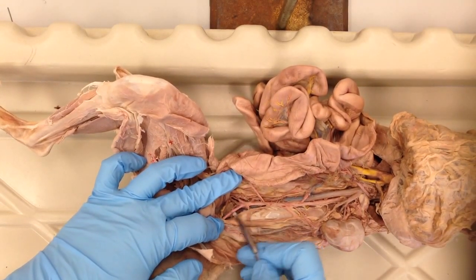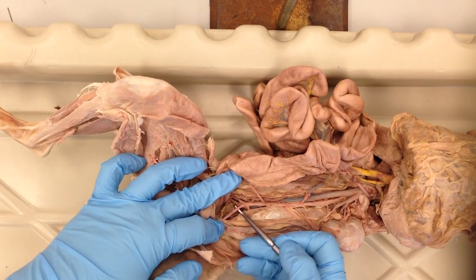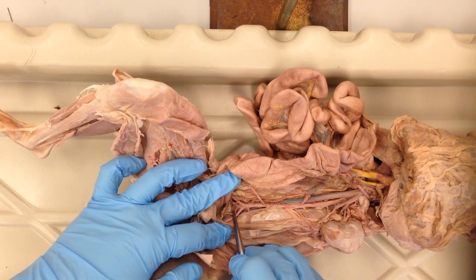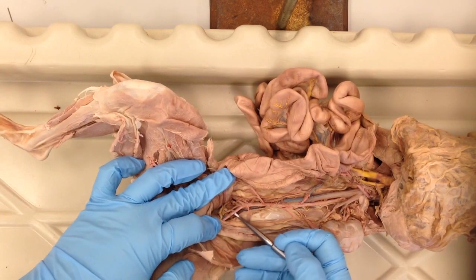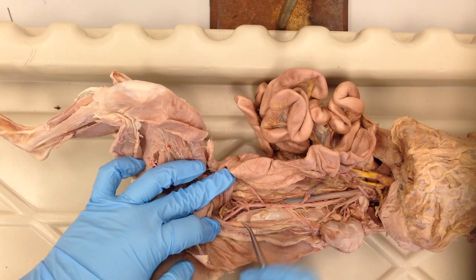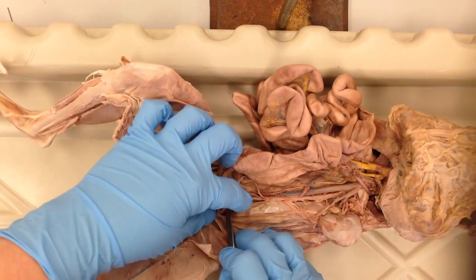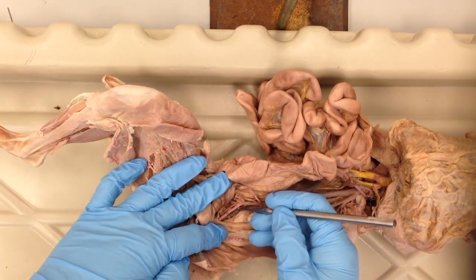What you have here, kind of different from the human, is the external iliac arteries branching, and then the internal iliac artery, and then there's a very center branch which is only one, it's not paired, and it's a tail artery. So you have the external and internal iliac arteries. The vena cava branches as well, a little bit more difficult to see based on the fact that it is deep to those arteries.